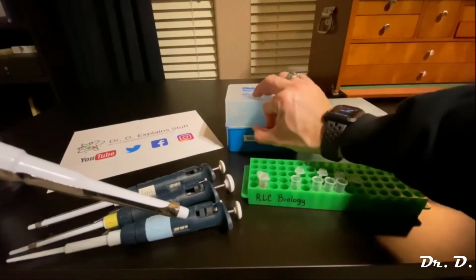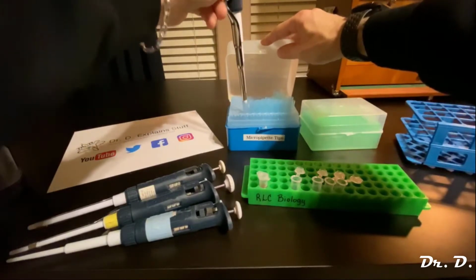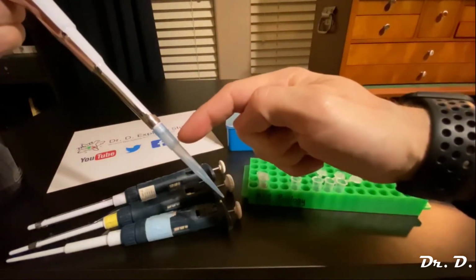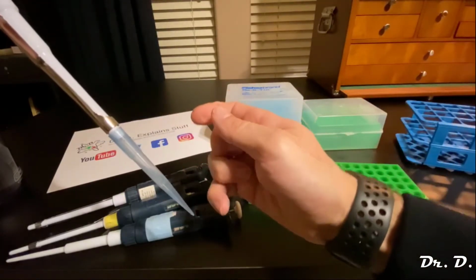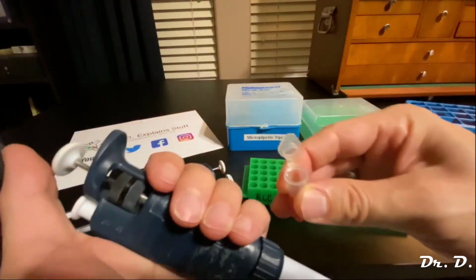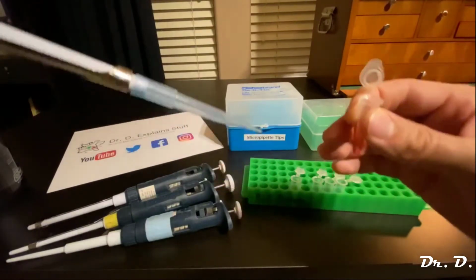So let me open up this box of tips. You see, these are the tips for the pipetter. Let me go ahead and tap, tap, tap. Okay, so now I've got the disposable tip on here. All right, here's my epi tube. I'm going to pop it open. They make a nice satisfying pop sound when you open them up. So here's something very important. You think I'm just going to suck up solution, right? How hard can it be? Well, you could actually mess this up.